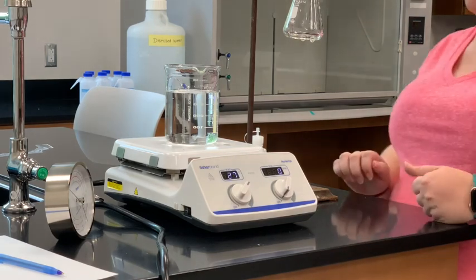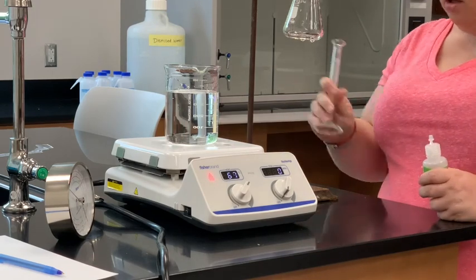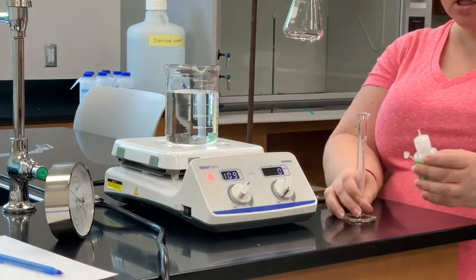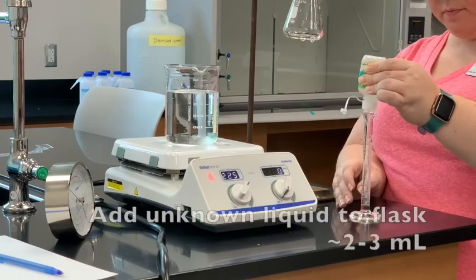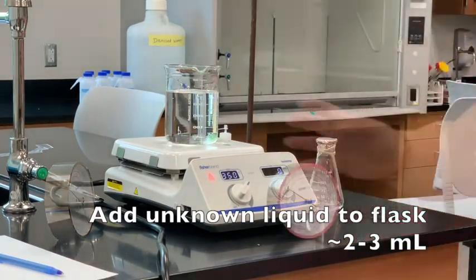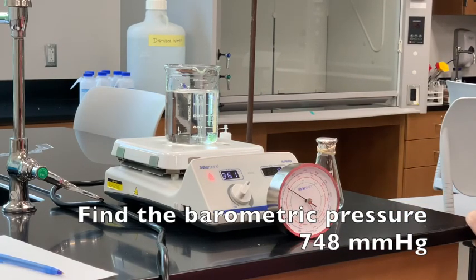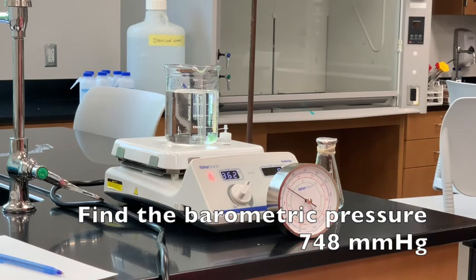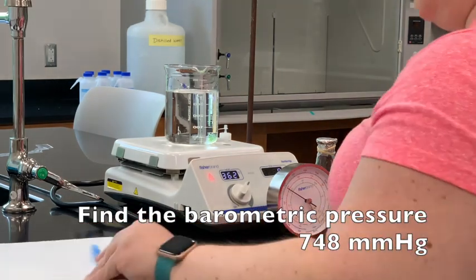While I'm waiting for that, I'm going to go ahead and add my unknown liquid to my flask. I'm going to measure out about two to three milliliters using a graduated cylinder. We're going to read the outside of the red scale on the barometer, which is in millimeters of mercury. The barometric pressure in here is going to be 748 millimeters of mercury.